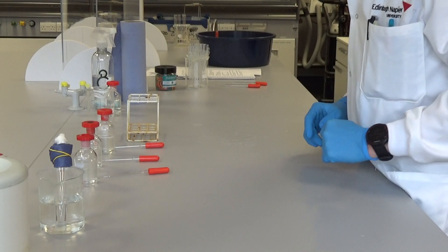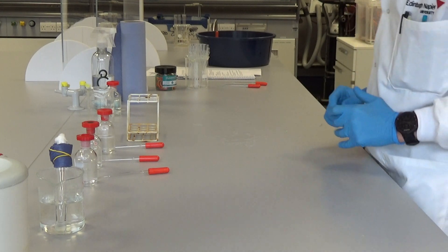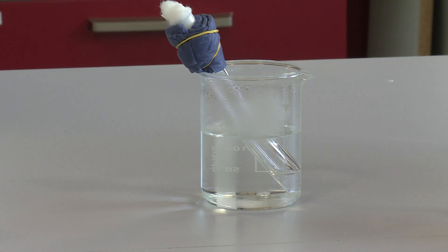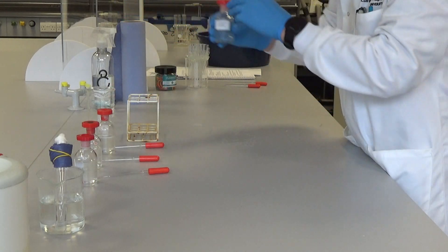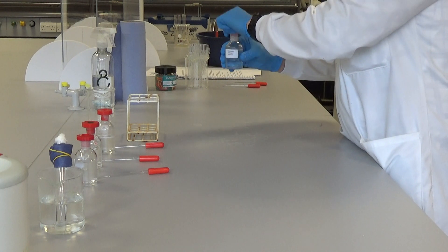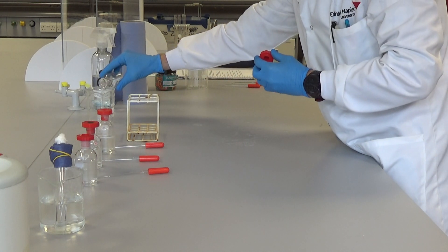After 10 minutes, what we're going to do now is detect if we have made any ester in the reaction. To do that, we're going to pour it into some sodium hydrogen carbonate solution.